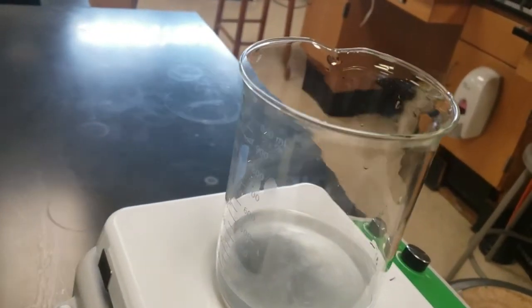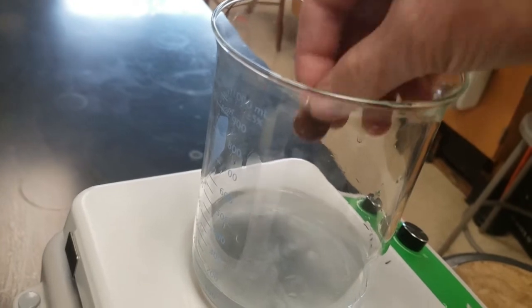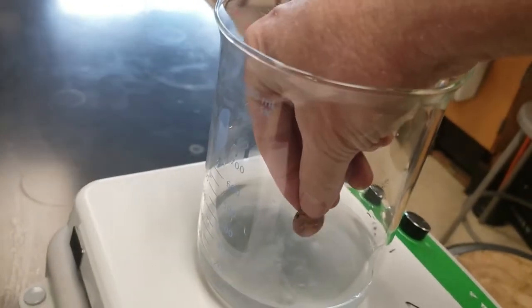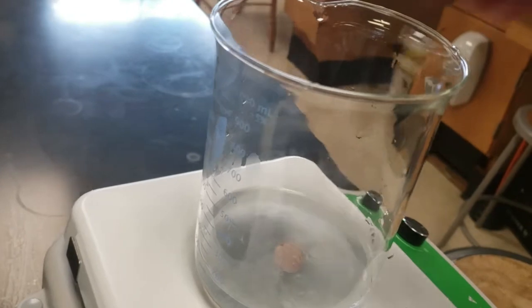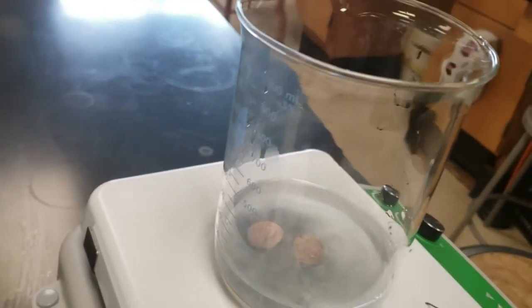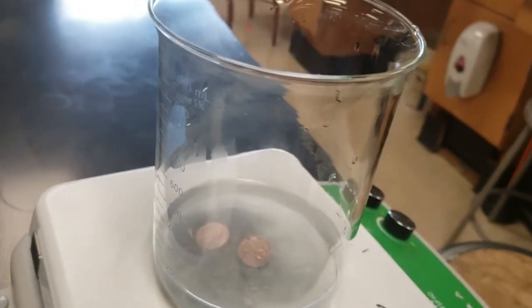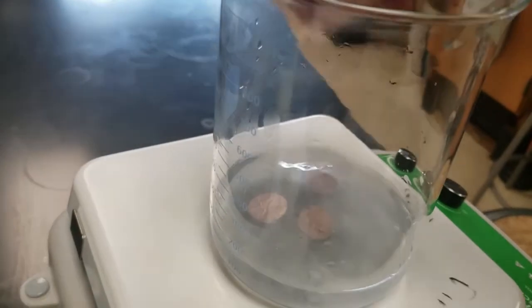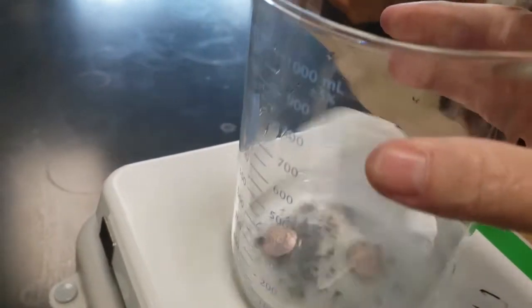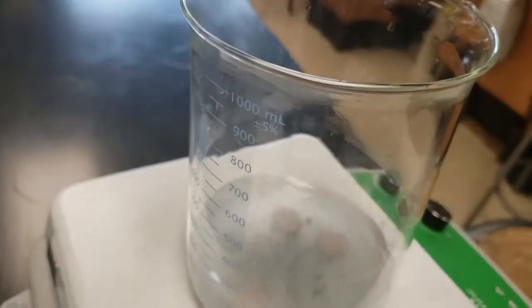I'm gonna put in a little powder zinc in here. We're going to heat it up. We want to get it hot and steamy but not boiling. If it's boiling, you should just take the beaker off the hot plate and put it directly on the lab bench.